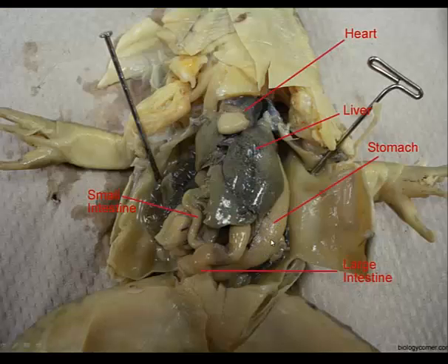Here's the stomach. The straight portion of the small intestine below would be the duodenum. The ileum portion is where you can start to see it folding over, and the mesentery is between the different folds.